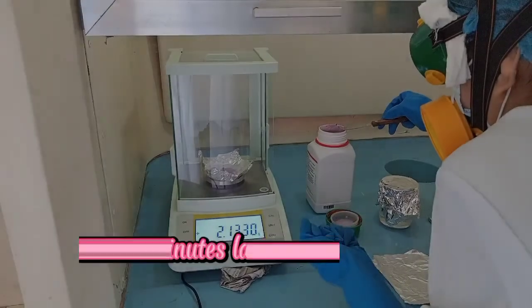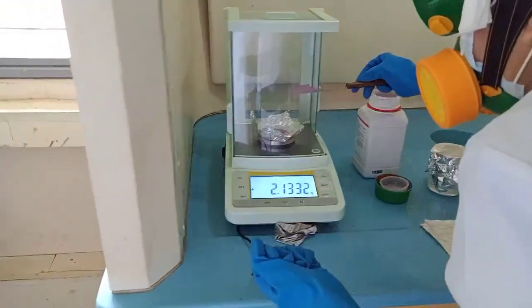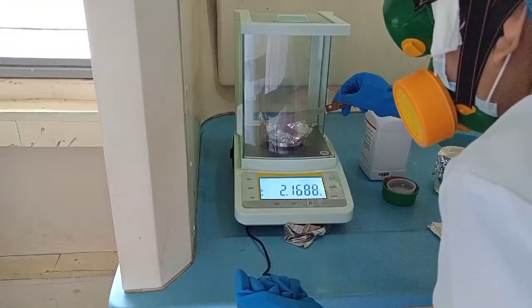A few minutes later — we have now weighed our broth.